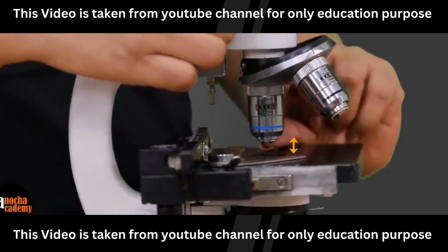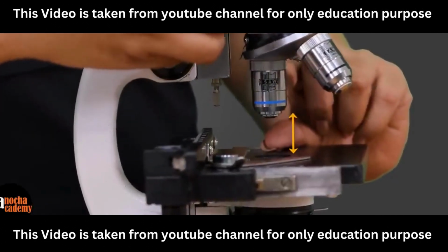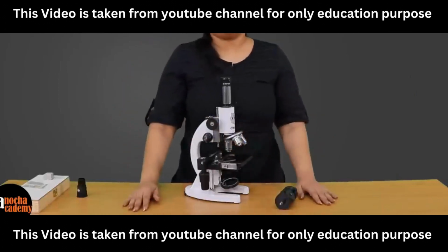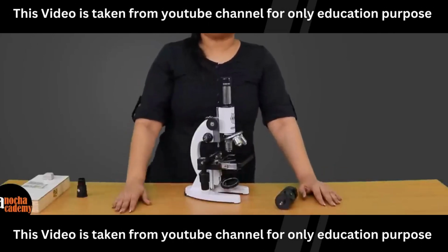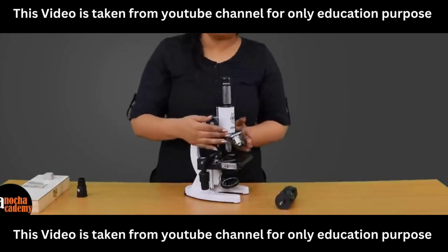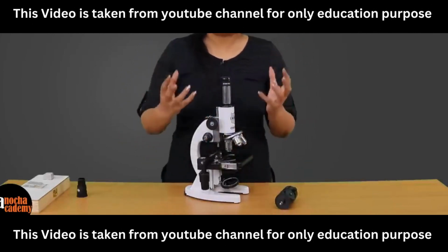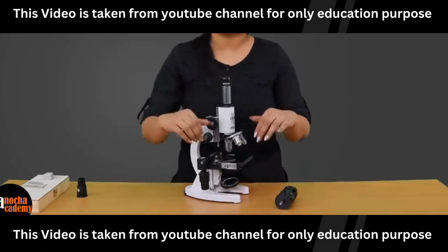This increases or decreases the gap between the stage and the objective lens, and that helps in bringing the image in focus. Now, we all have different powers in our natural eye lens. If you wear specs, you have a different power, I have a different power, and that is why even after I focus the object with the help of this coarse adjustment screw, it may happen that it is exactly focused for my eye lens, but not for yours because you have a different power.